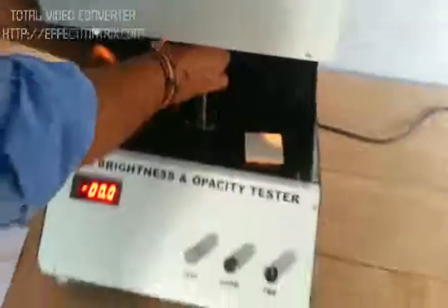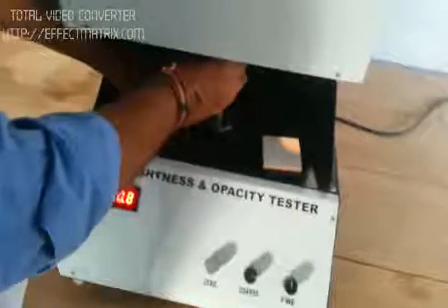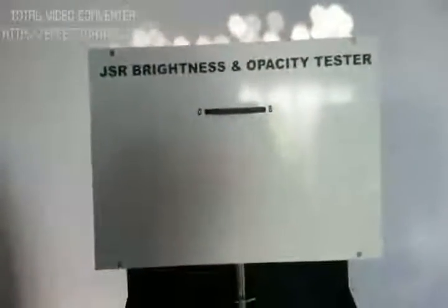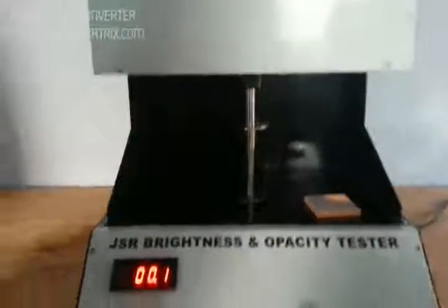This is how we operate the machine. Initially, once you provide power to the system, two light sources turn on. We put the black cavity in initially. We select the filter — for brightness measurement, we select brightness and place the black cavity.